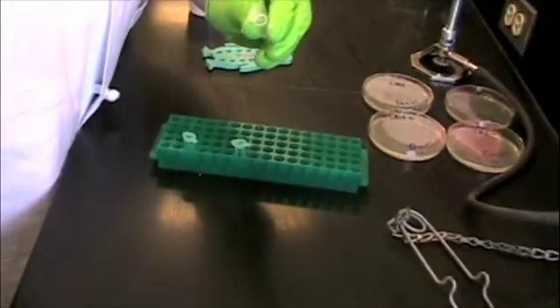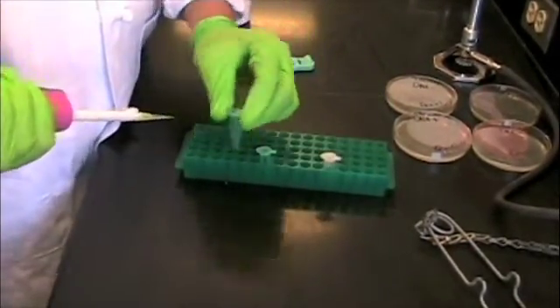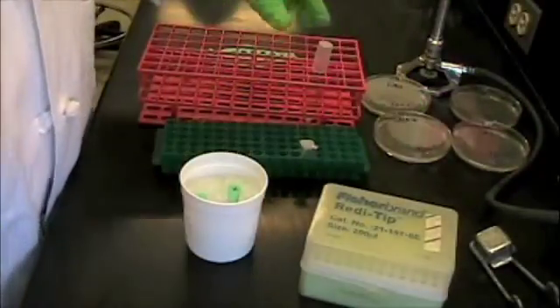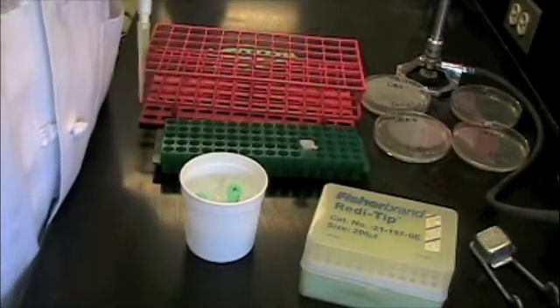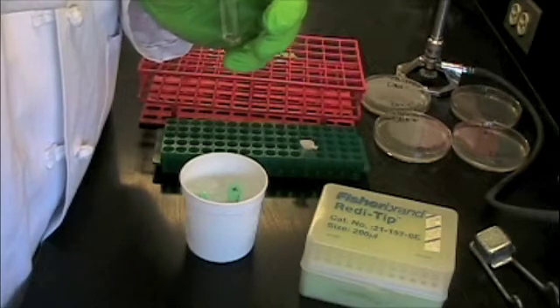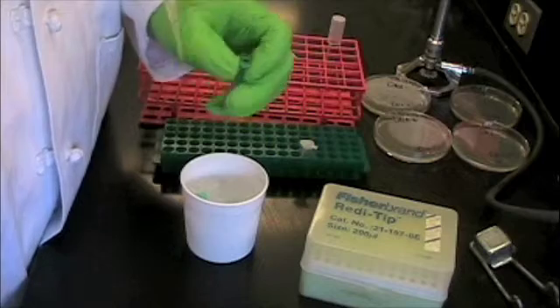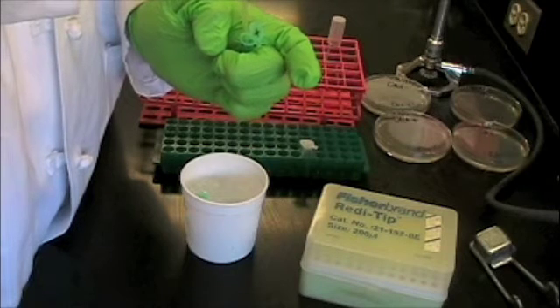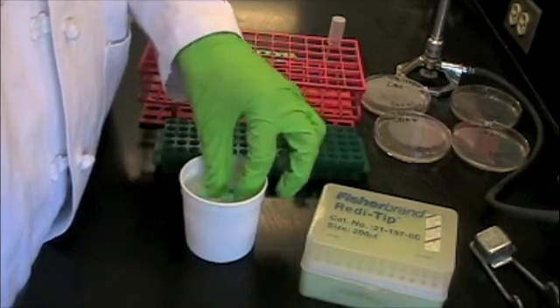The first step is to take 125 microliters of calcium chloride and transfer it into both the DNA plus and DNA negative microtubes. The microtubes should then be placed on ice for several minutes. Take the E. coli test tube, flame around the lid, extract 125 microliters of bacteria, and flame again to keep it sterile. Release the bacteria into the DNA plus microtube, then place it back on the ice. This same process should be done for the DNA negative microtube.